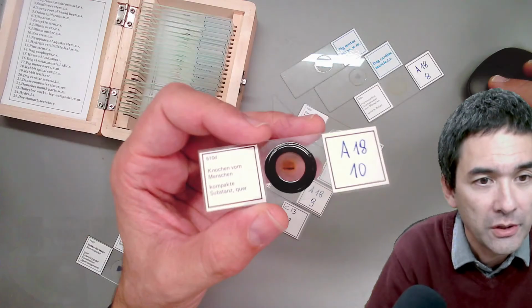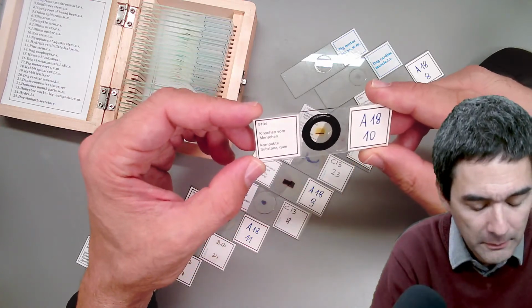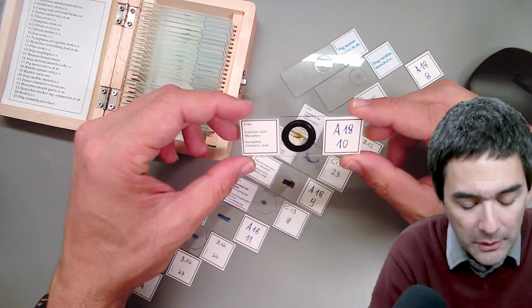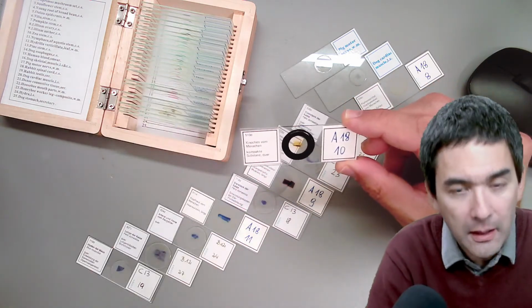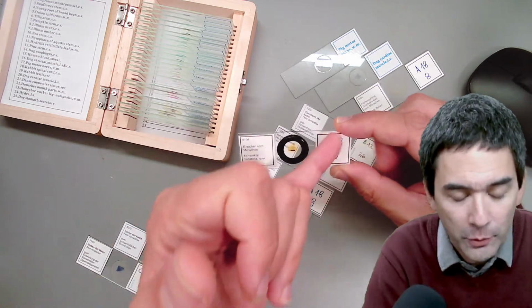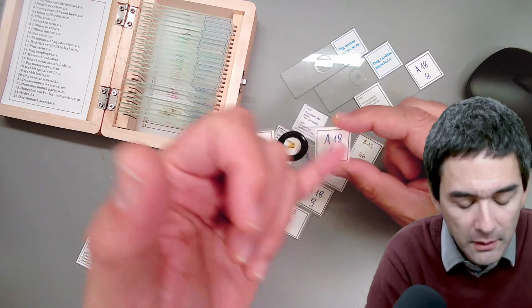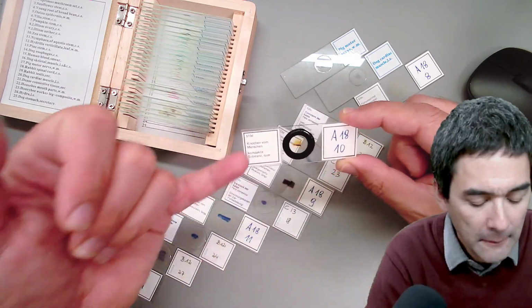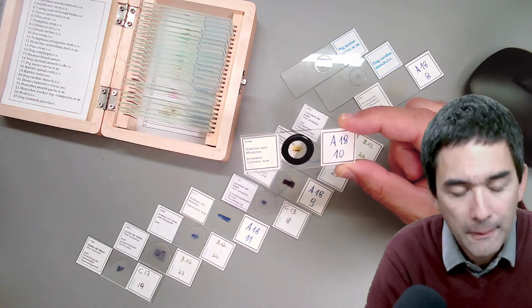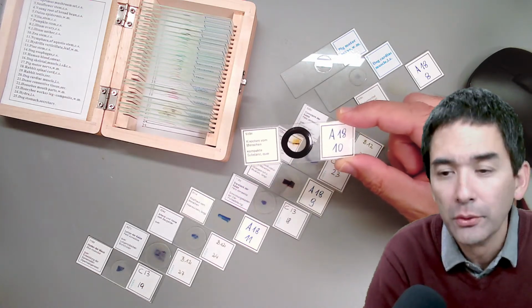Okay, so I'm going to show you here. It says here bone from a human bone. It's a compact bone cross section, and that's it. It does not tell me anything about how it was processed, which I personally consider a little bit of a pity, because there's so much space here on the right side where you put the number. You could actually provide some valuable information here as well, but it only says bone from the human being. It's compact bone. So I have to tell you, sorry, I don't know.